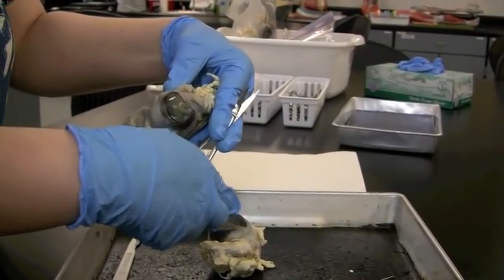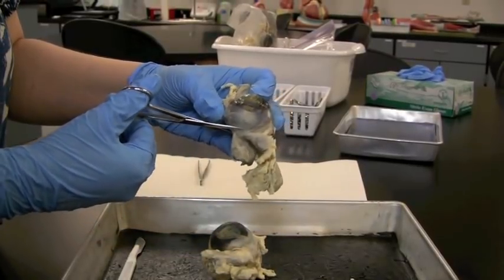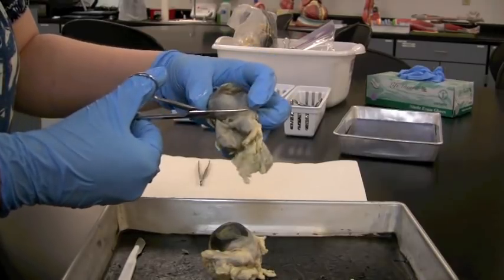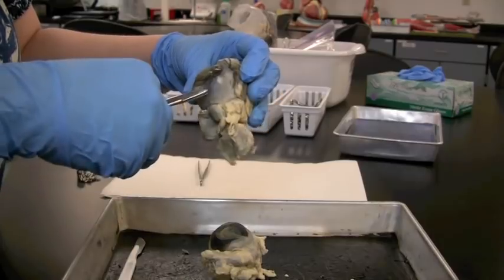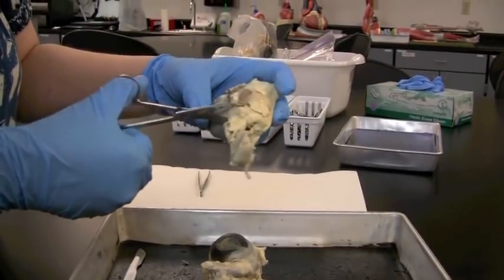It's a little bit different on a cow than a human. But I'm just going to go ahead and trim all the way around it. I'm not afraid to make some pretty big cuts because this eyeball is a pretty tough guy. It's going to take a lot to work my way through this tough outer layer. So I'm not afraid to really snip into it.